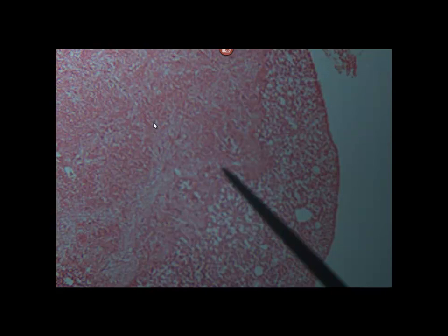The posterior lobe is nerve tissue. And there is a cell type there. But the posterior lobe does not produce any hormones. They are produced in the hypothalamus and released from the posterior lobe. But here's the anterior lobe. Now, I think I can just click, I did. Here's a little closer view. This is on the 400. See, there's the posterior lobe. Over here would be the anterior lobe.